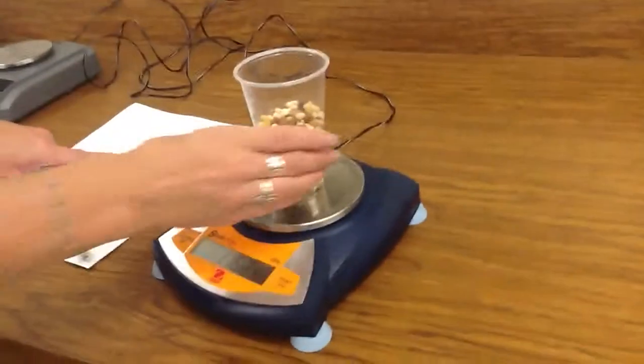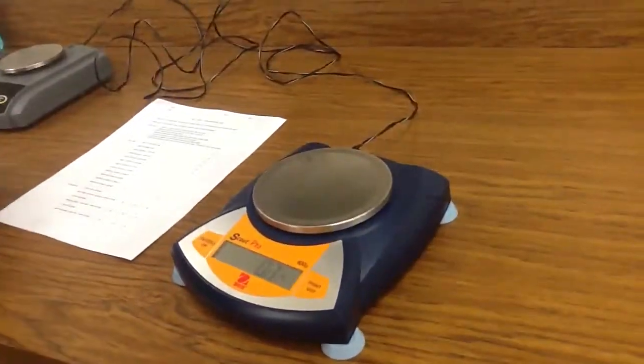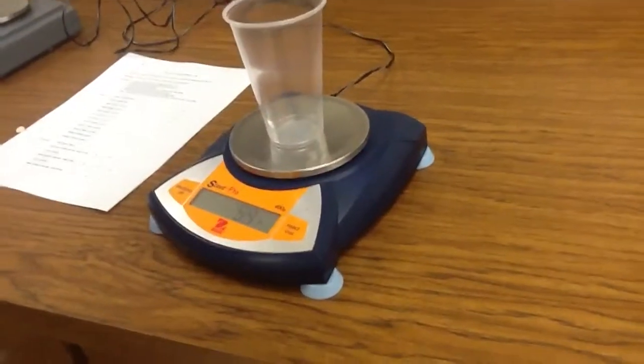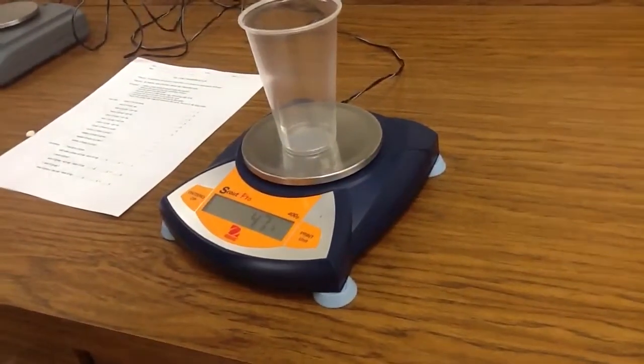Then you're going to take a mass of the cup empty. Pour out your beans and mass your cup. Record that weight.